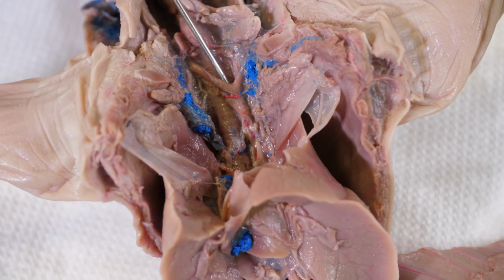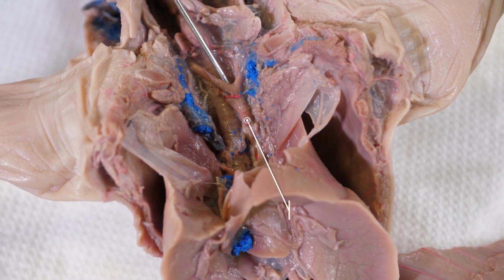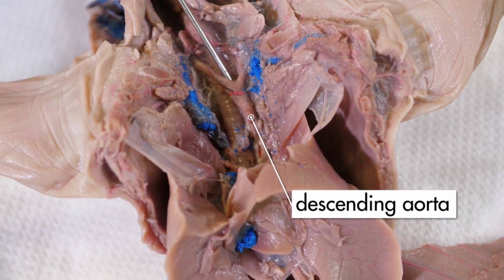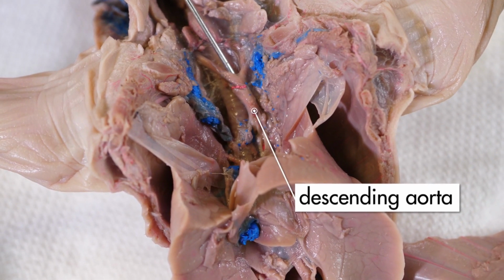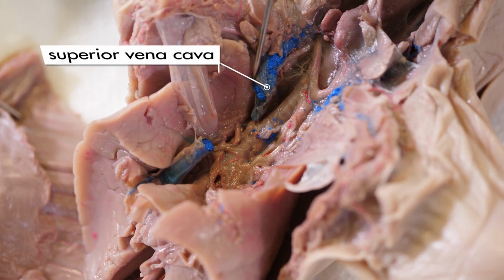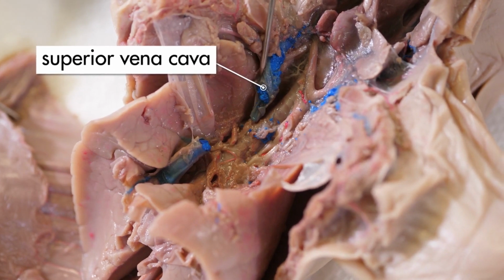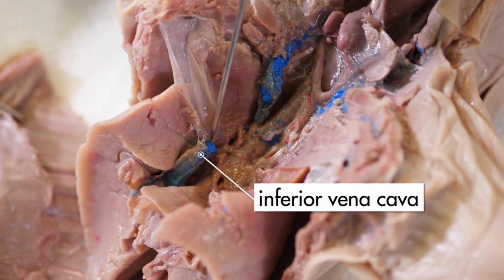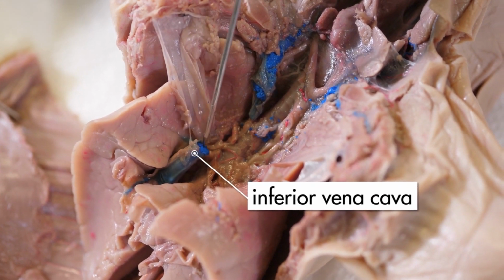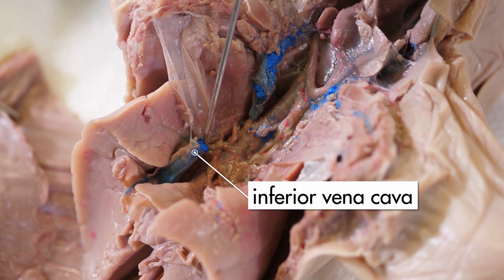Now we will look back into the body cavity. We can see the descending aorta, which is the branch of the aorta that carries oxygenated blood to the posterior regions. Notice the superior vena cava, which is the vein that brings blood back to the heart from the anterior regions of the pig. Also notice the inferior vena cava, which is the vein that brings blood back to the heart from the posterior regions.